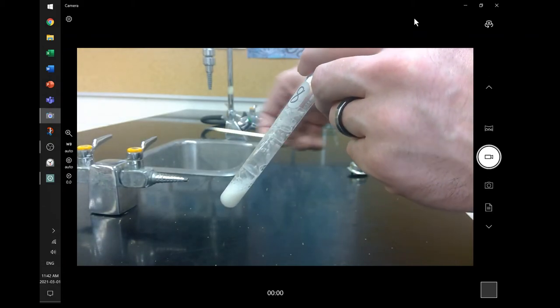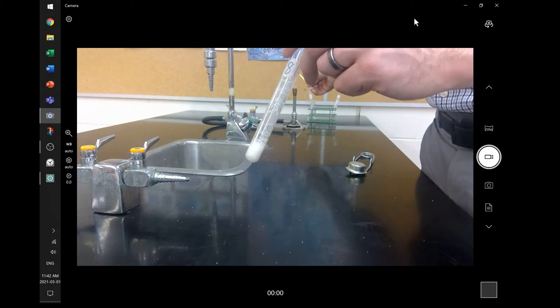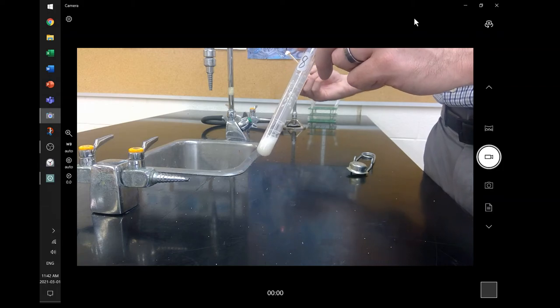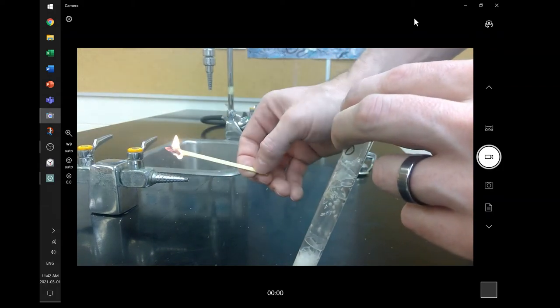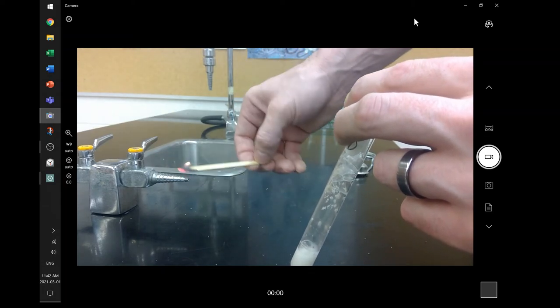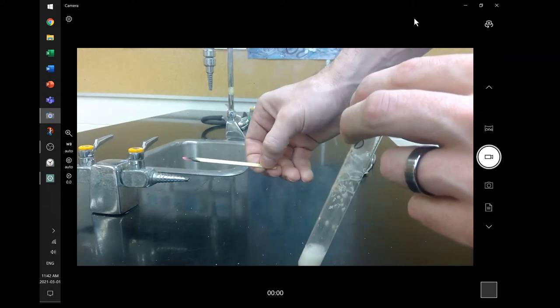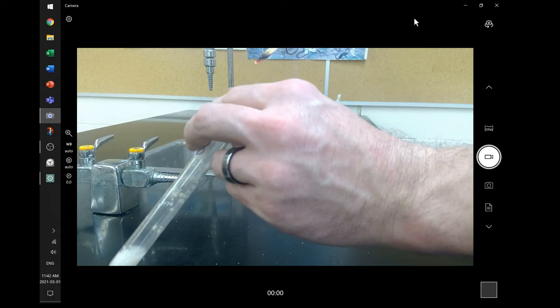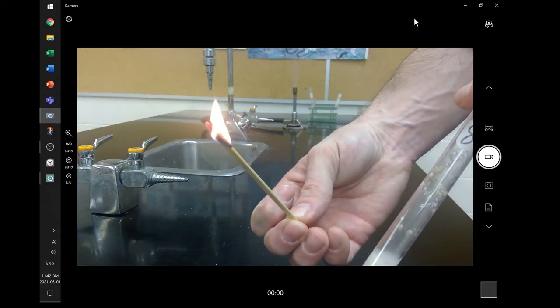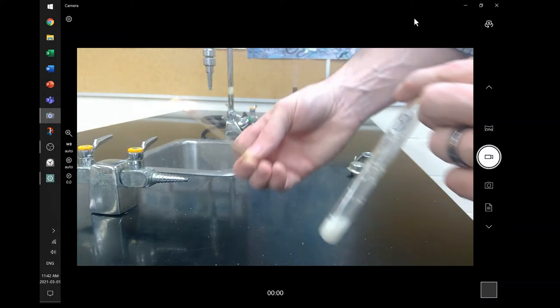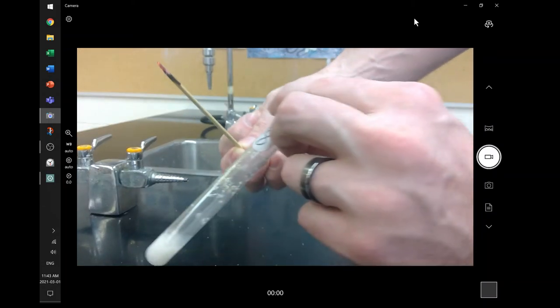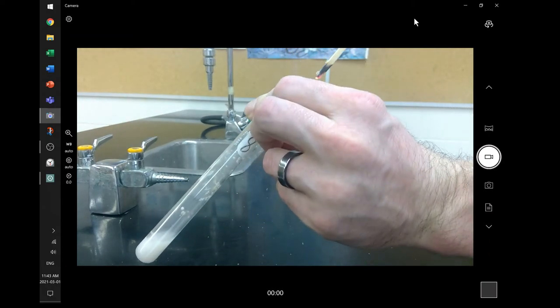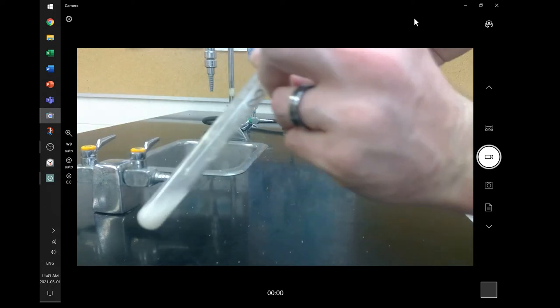And again, two tests. So first, my splint. Later up, I'm going to get my embers first. I'm going to do the glowing splint test. The embers. Nice and orange. Nice and hot. Embers. So glowing. So that's a burning splint. Flaming splint. I don't want the flame. I don't want the burning one. I want the glowing one. So rough shake and glowing splint test. And then into my gases. I don't know. Did you see that? I had my hand in the way. But there it actually is. Flame again. Let's see if we can do that one more time. So shaking out the flame. No flame. Just the hot ember. Gas. What gas is this? And I just don't have enough for a nice positive result. But maybe you saw that flame pop out.